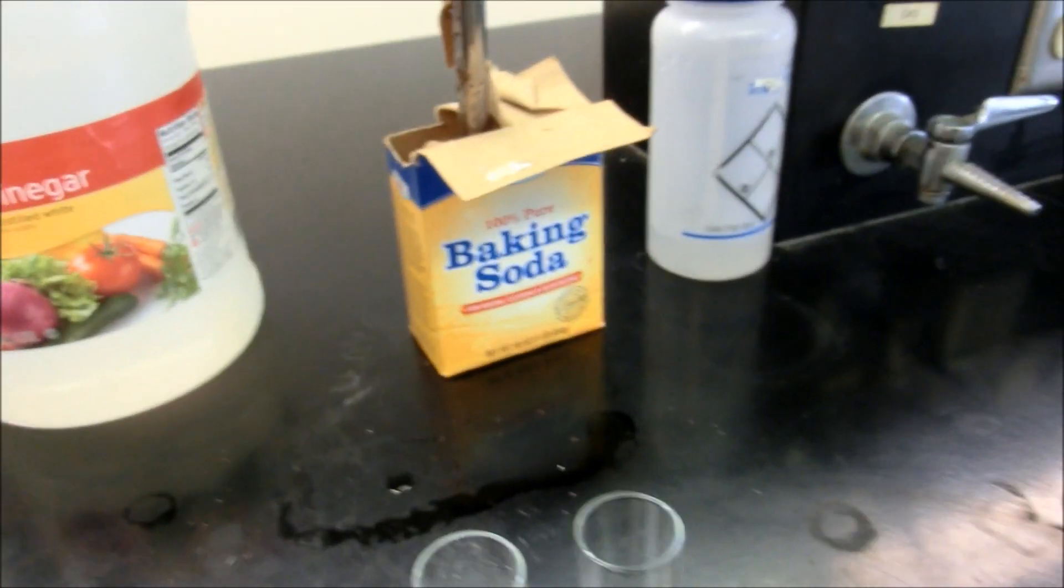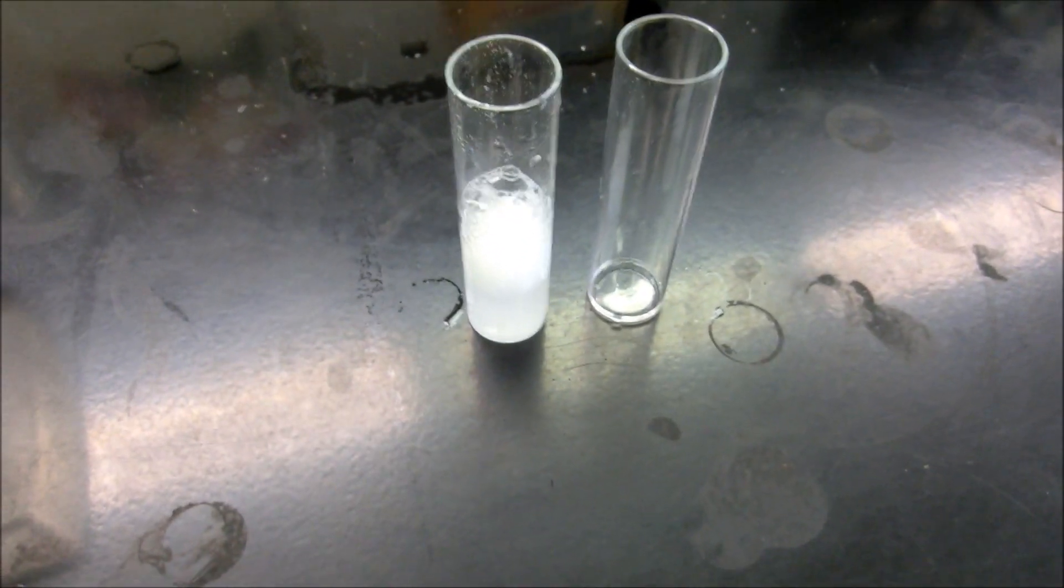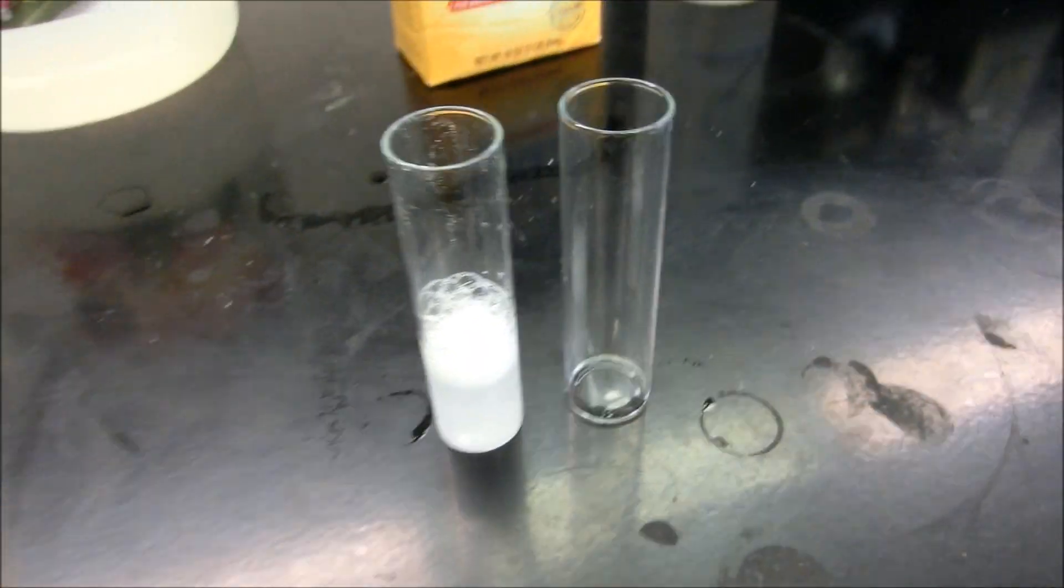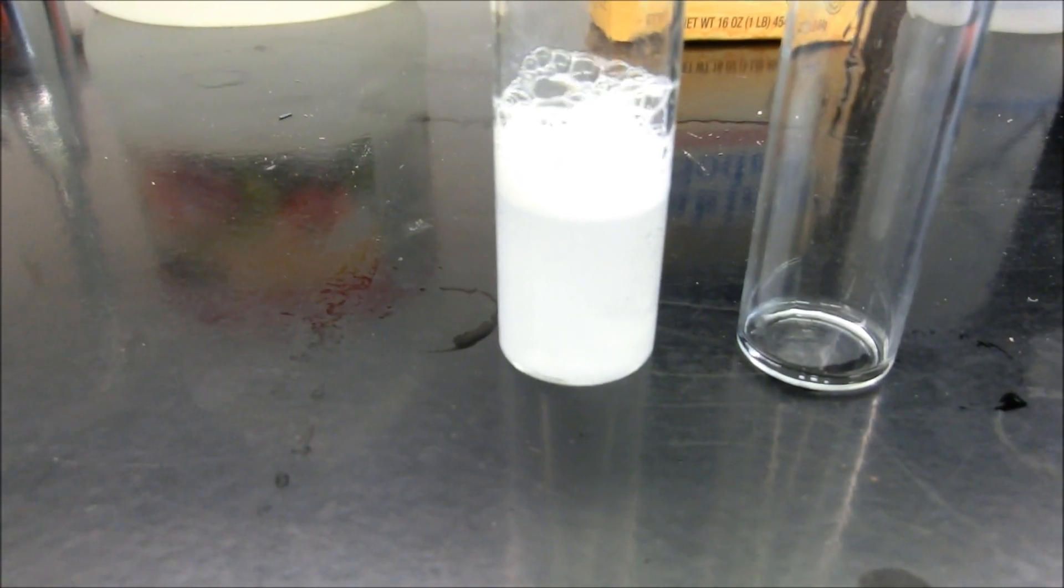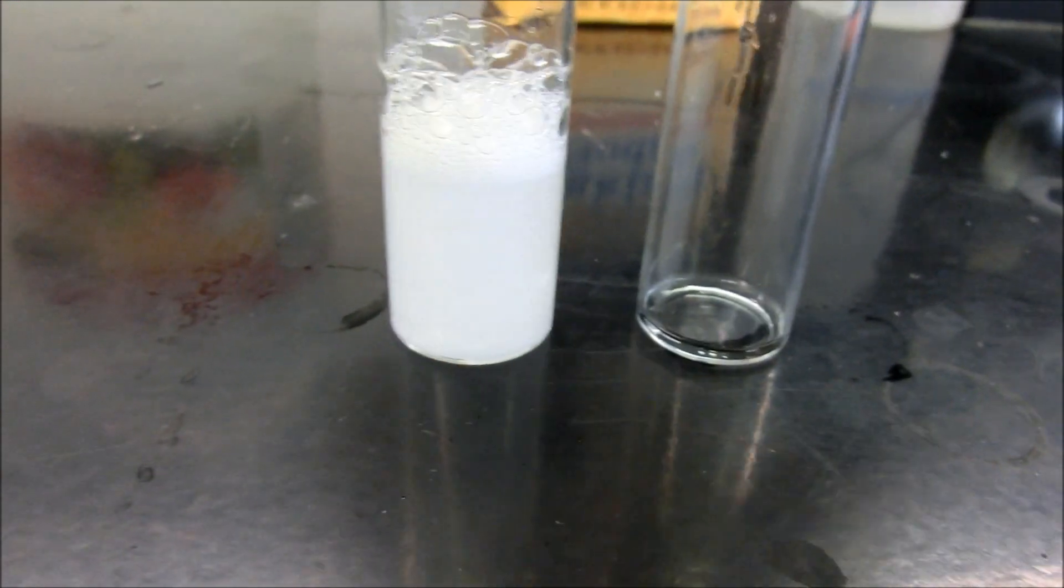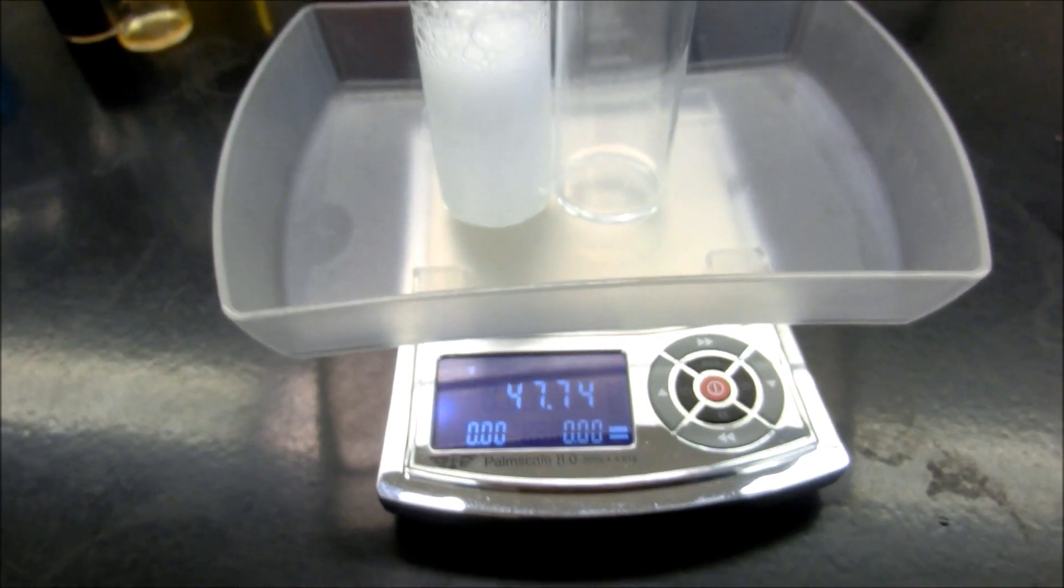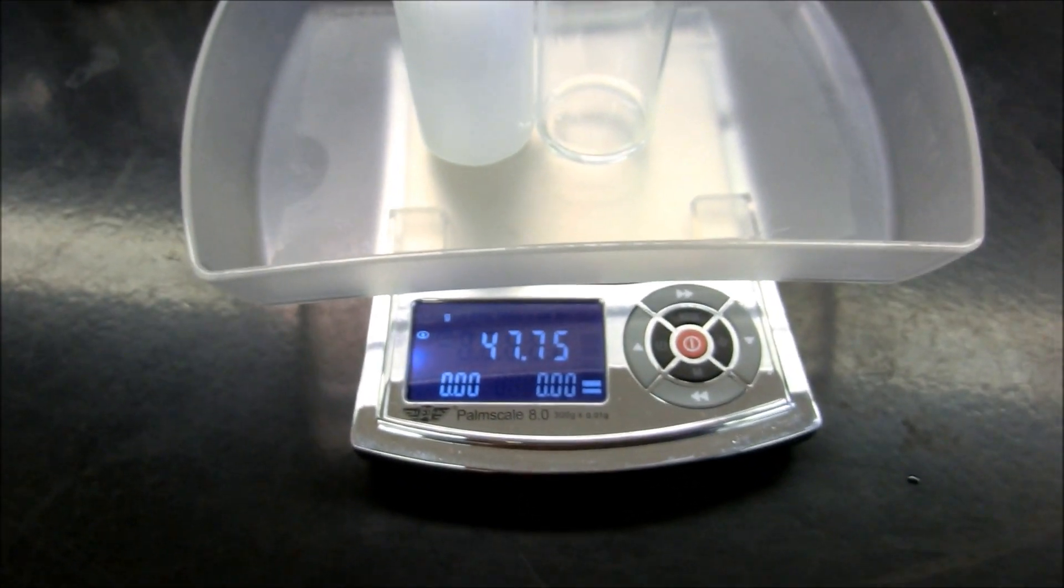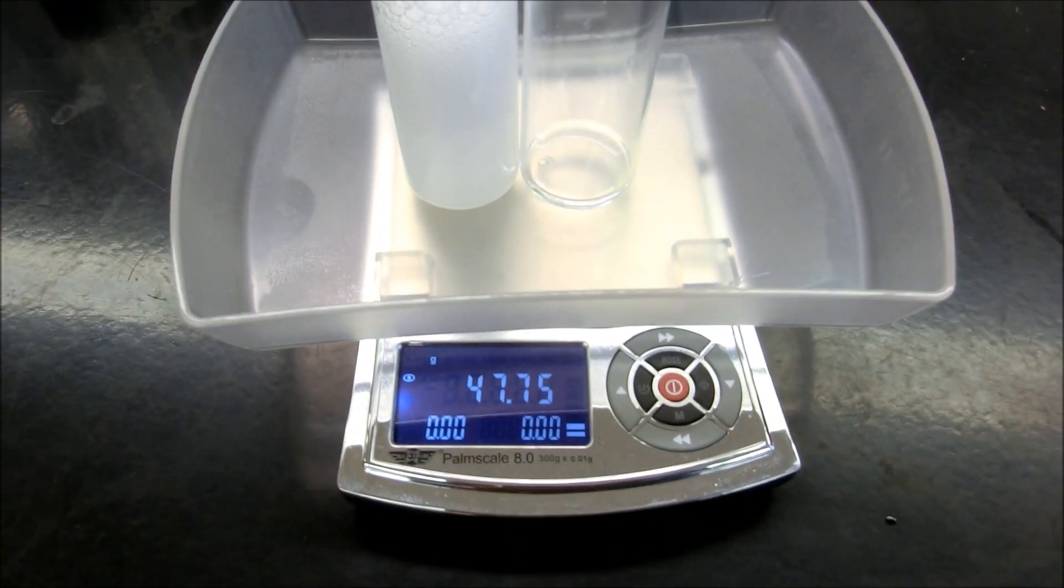Alright. So we'll wait for the bubbling to completely stop. That's good enough. And let's go ahead and weigh those two together again. This time the mass happens to be 47.75 grams.